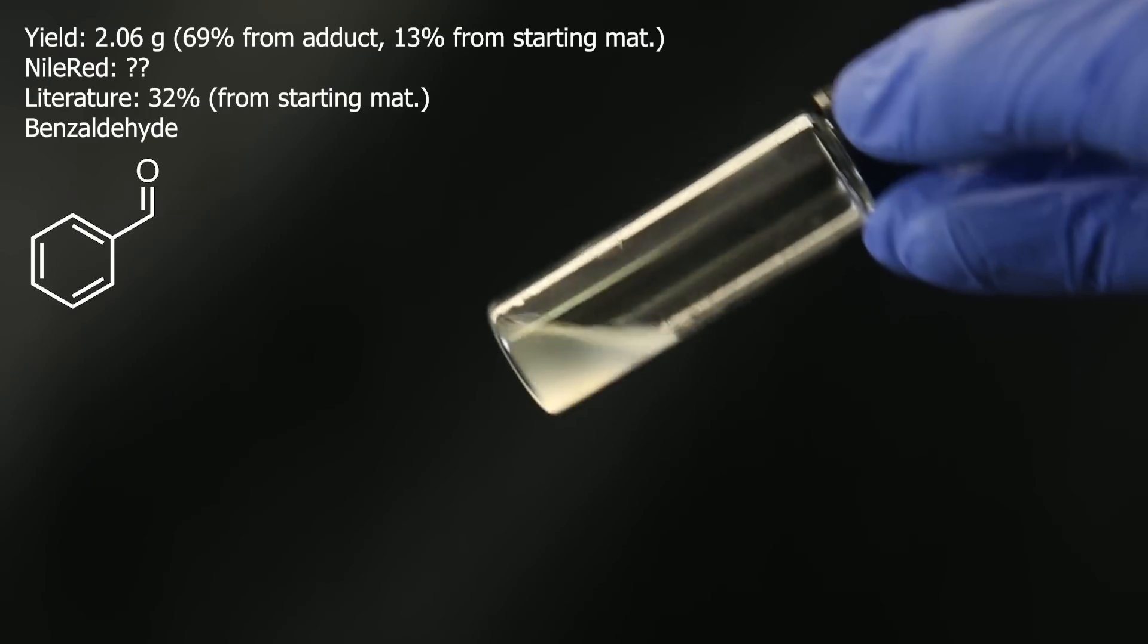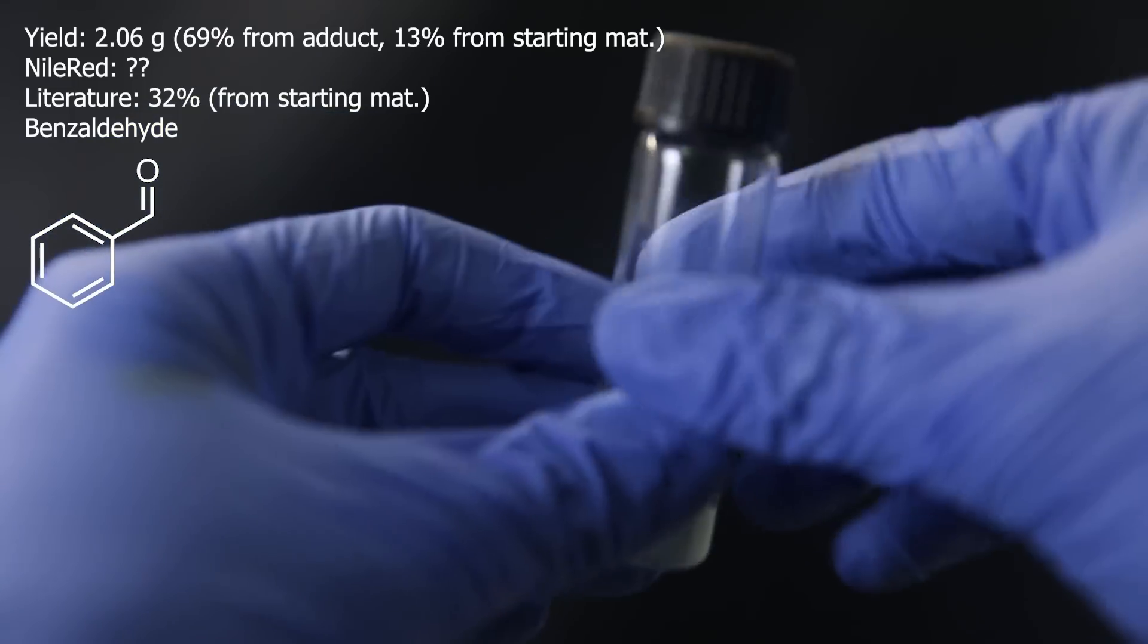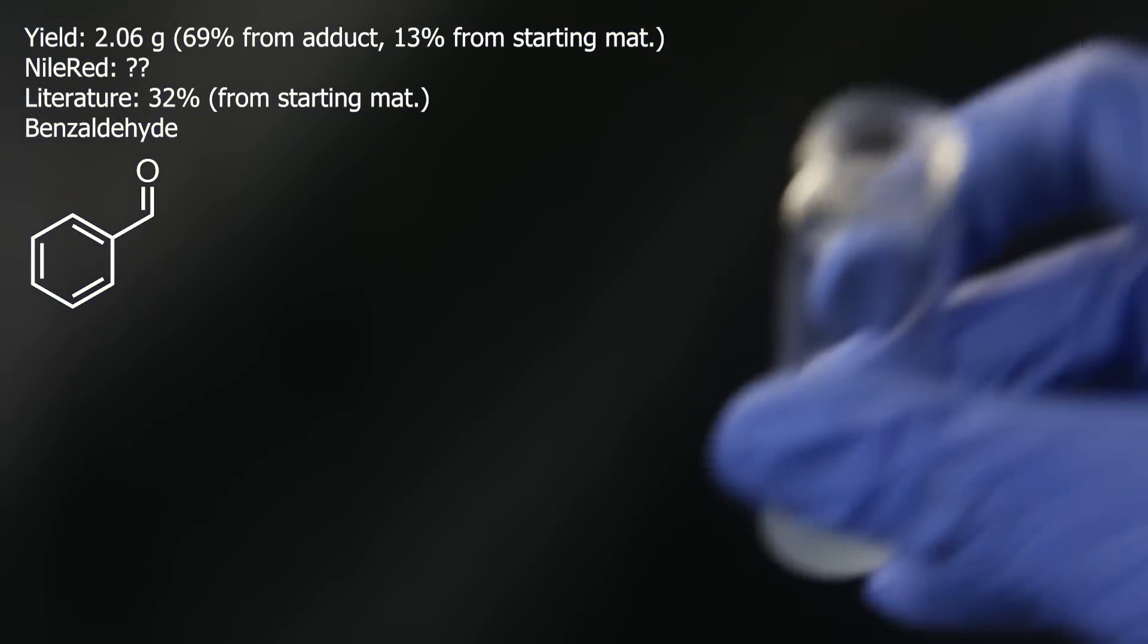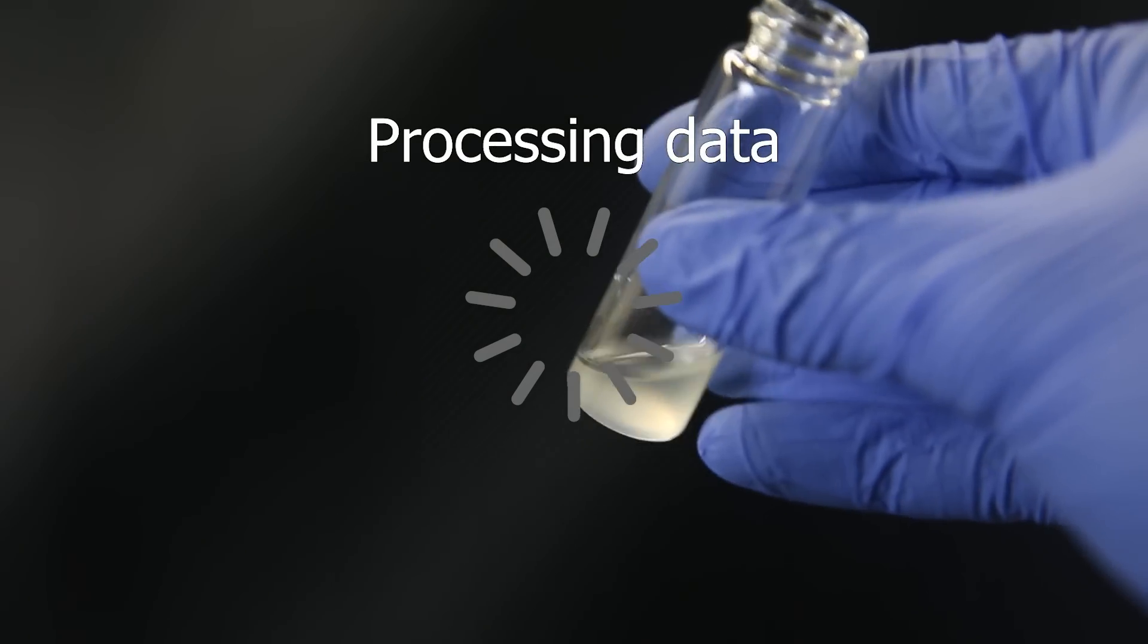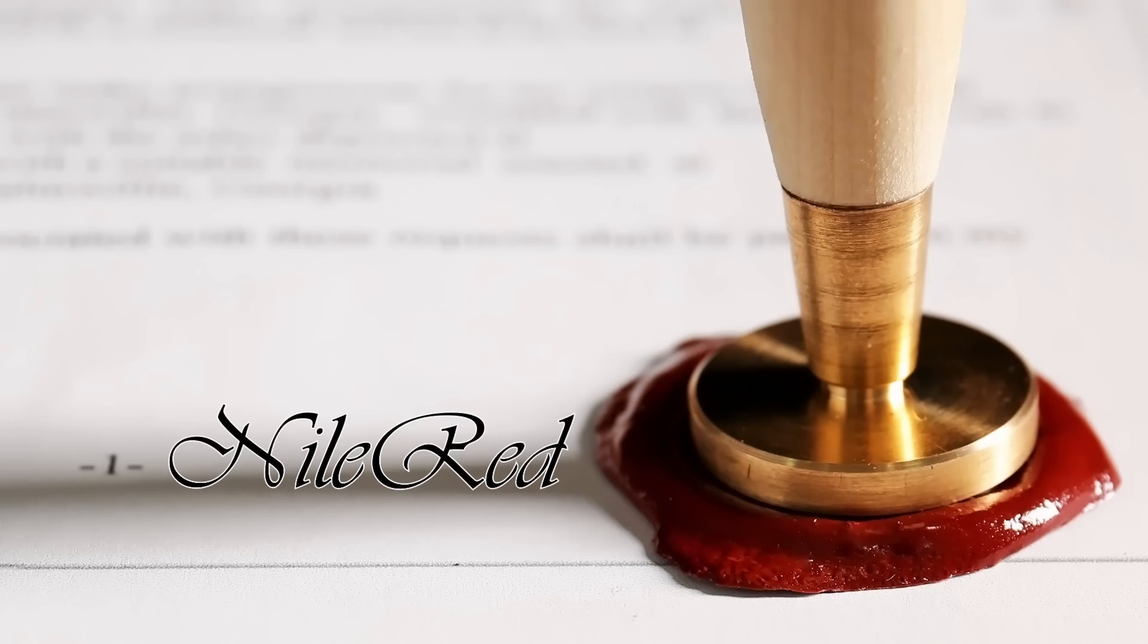NileRed uses an NMR machine to confirm his product, but I'm not rich like that, so I will use my god-given olfactory sensors to confirm the presence of benzaldehyde. The test turned out to be positive with a delicious almond smell, so I will give NileRed the seal of approval for reproducibility.